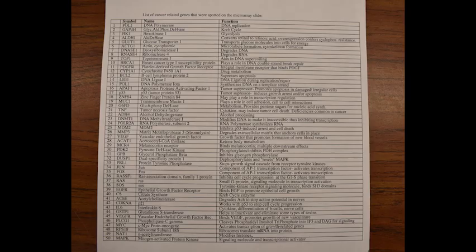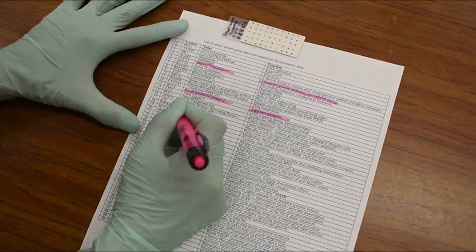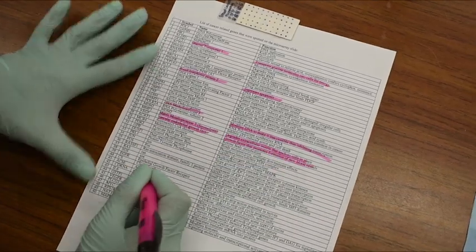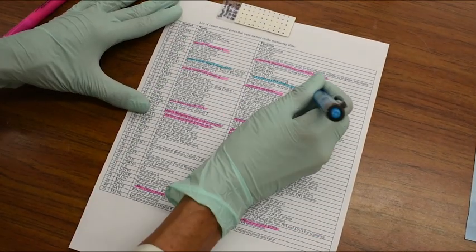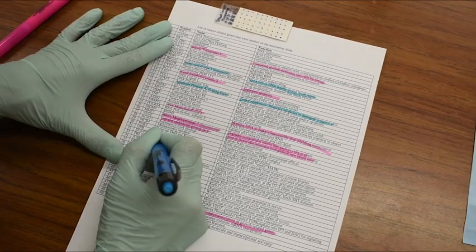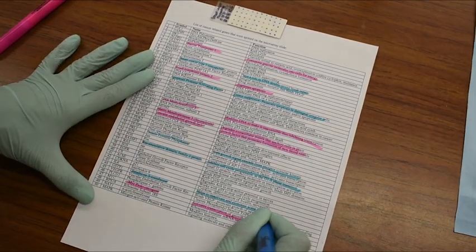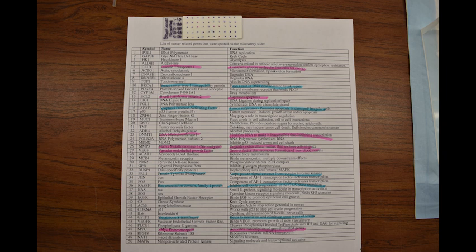Then, take a look at the list of genes which were represented on this slide and highlight the upregulated as well as the downregulated genes. You can search each of these genes and read more about how they function in normal tissues versus how they function in cancer cells.